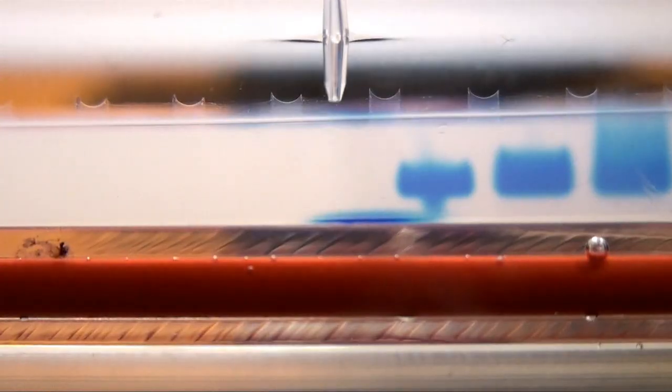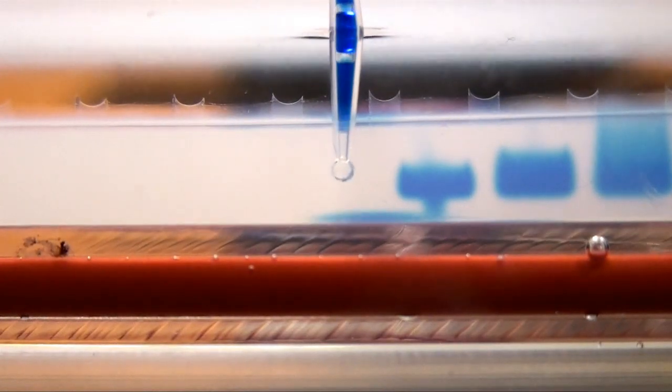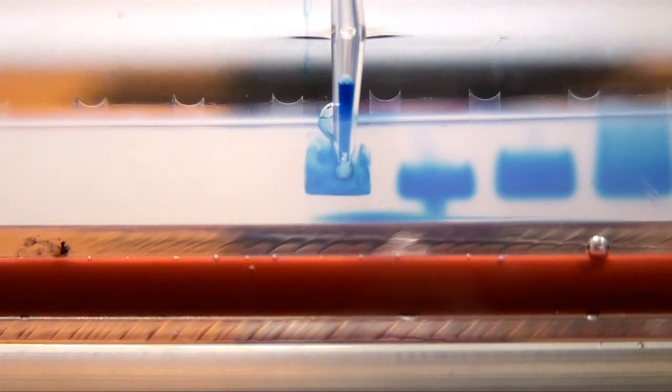The second one is air bubbles within the tip. If you see this, be aware of it before you try to load. Put it back into your tube and draw it back up without air bubbles. Air bubbles in the tip will cause dispersion of your sample and possibly lead to some loss of your sample.